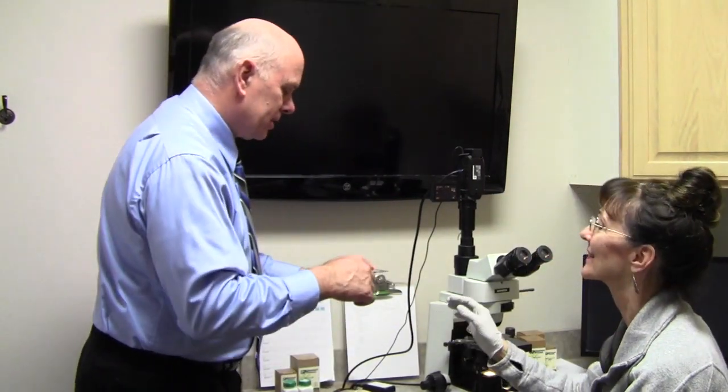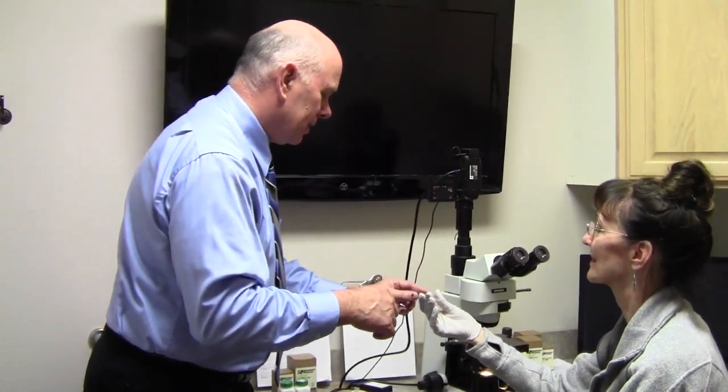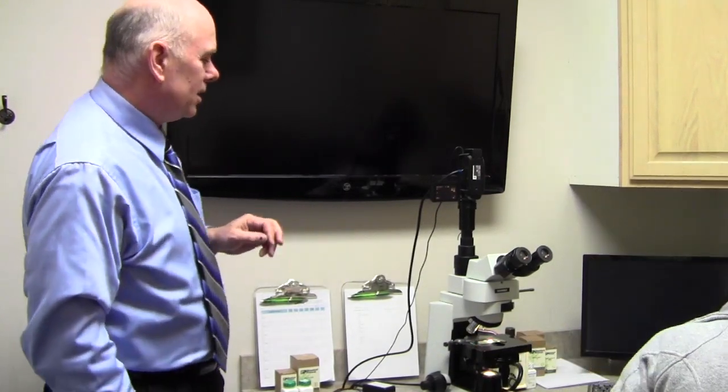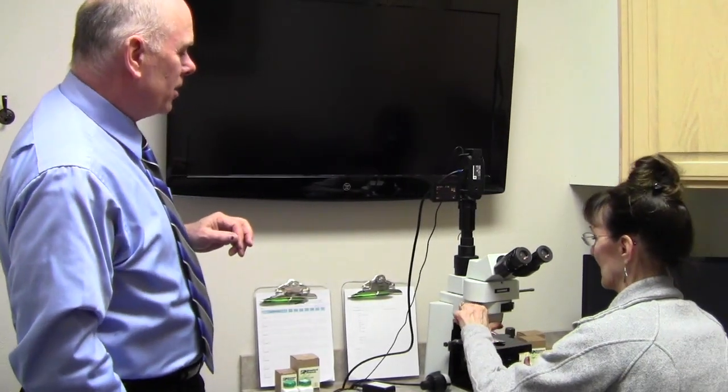Do we want to put a cover on this? Okay. It's a bit too much there, okay? So it's interesting, I've done this a couple days ago, and so the stuff that's floating in your saliva is just, it's not nice looking. So she's doing that, so we're going to take a look and see what we have underneath there.